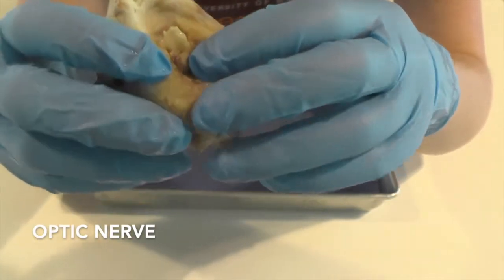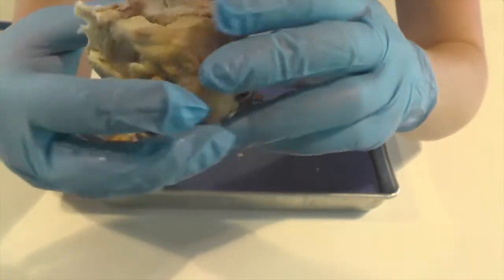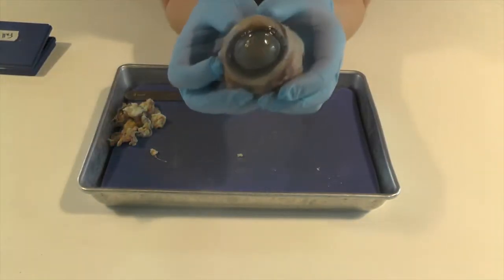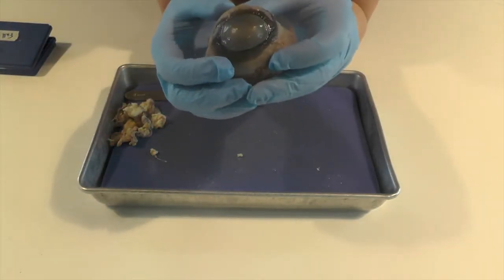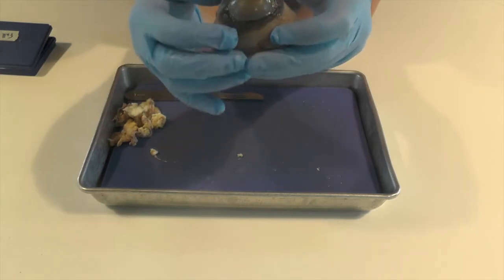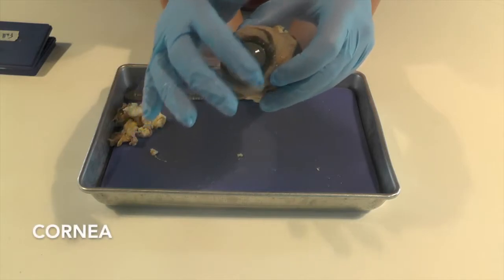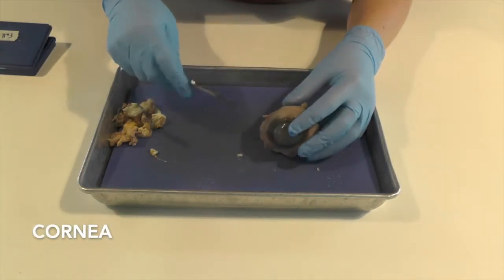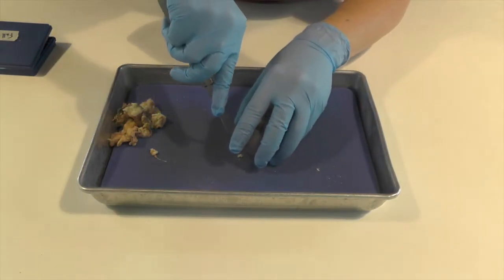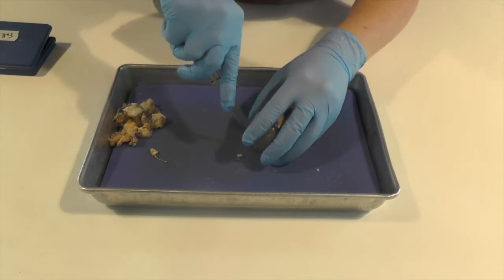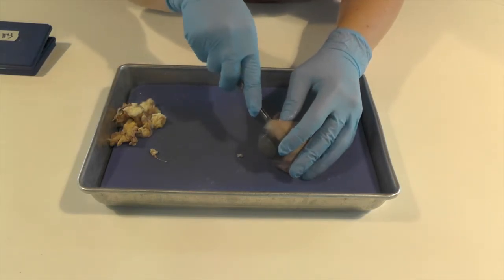And I can talk a little bit about that later on. But first on the outside you'll see here's the exterior of the eye. Normally there might be some eyelashes around here. And right away we can see the cornea which is this protective outer layer here. Now let's see what it looks like on the inside. So I'm gonna cut our eyeball right in half.